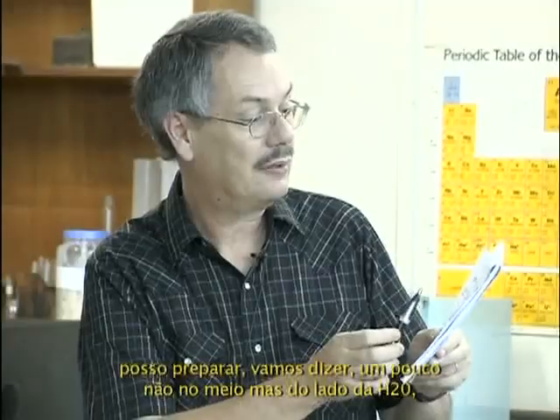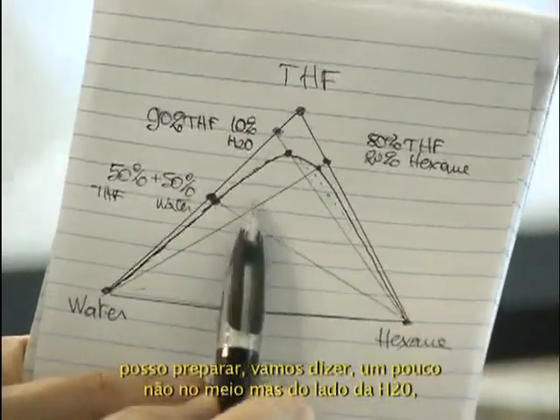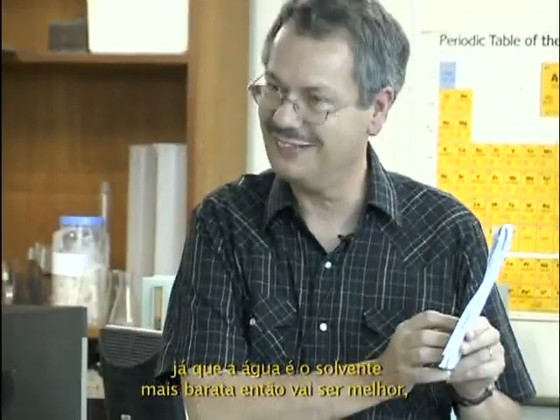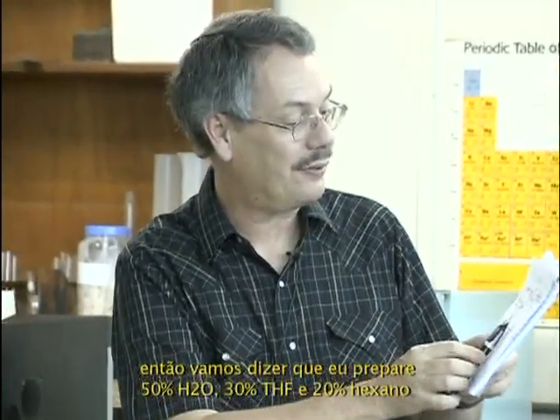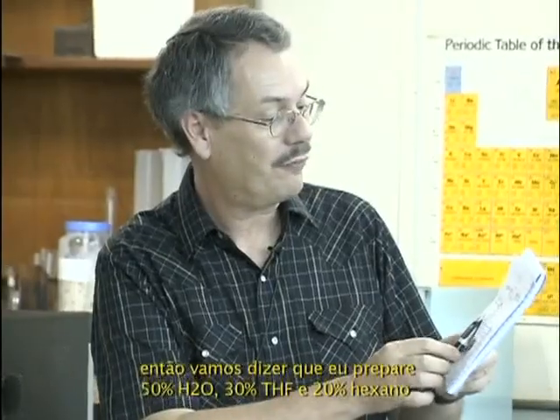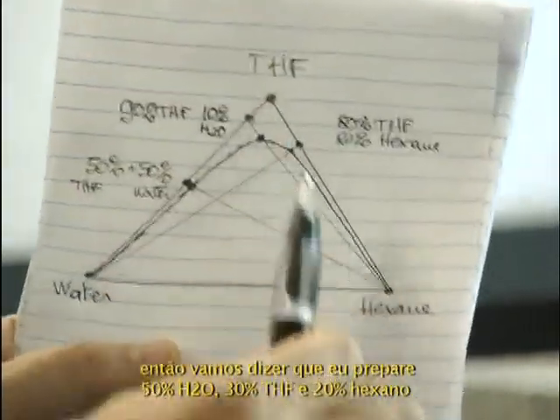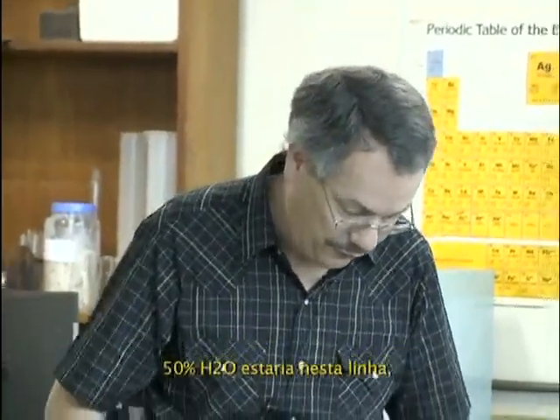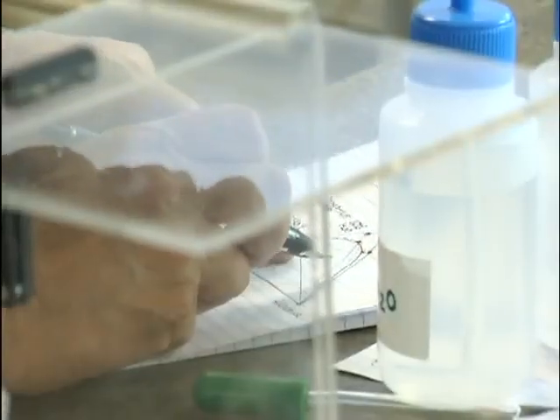Say, I can prepare a little bit, not in the middle, a little bit on, let's say, the water side, since water is the less expensive solvent, that would be better. So let's prepare 50% water, 30% THF, and 20% hexane. I will try to put it by hand, it's difficult. 50% water would be on that line. 1, 2, 3, 4, 5, 6, 7, 8. 1, 2, 3, 4, 5.